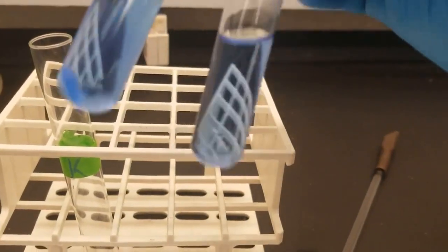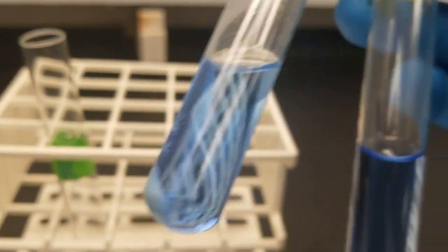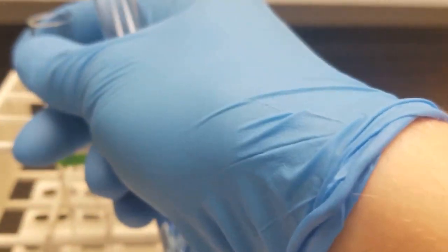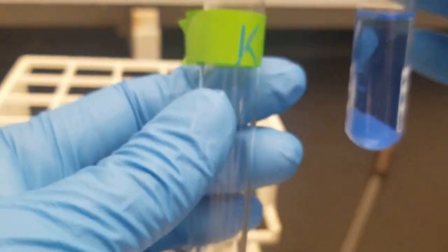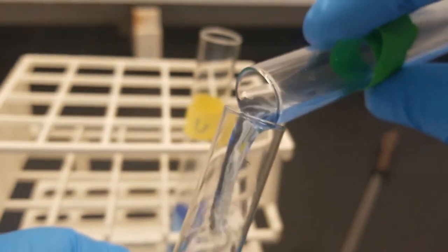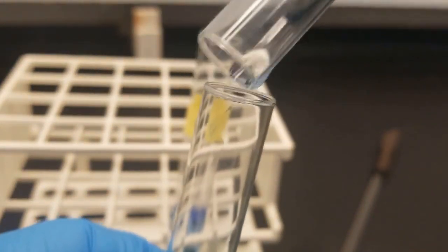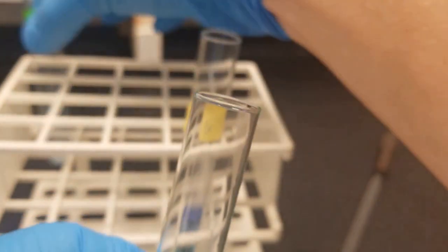All right, so off screen, I've gone ahead and centrifuged the solution. You can see in our known, we have the solid white precipitate, and in this unknown, we do not have any precipitate. So we can't decant if we don't have a solid, so we're just going to decant the known into a new test tube to save for later. Actually, we're going to use the supernatant and keep the precipitate for later. Let's go ahead and just decant. And we'll save the precipitate for later. And we'll keep working with the two supernatants.